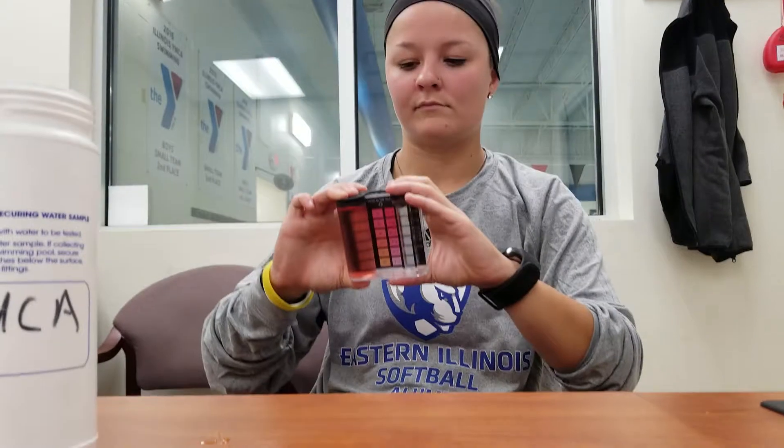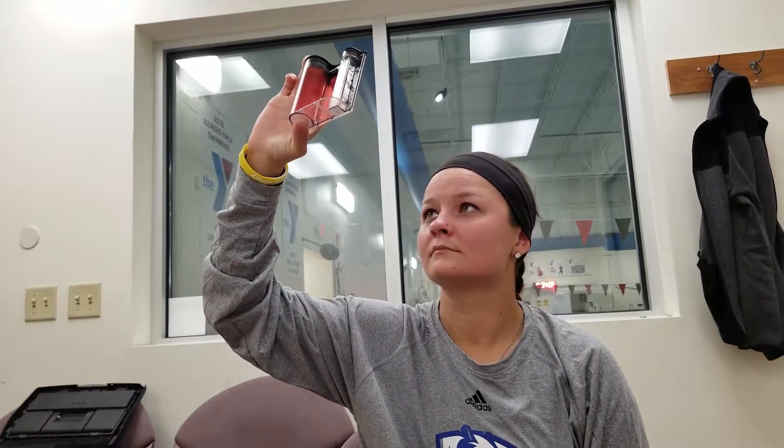Now we would simply pour this out, record our number, and move on to the next sample.